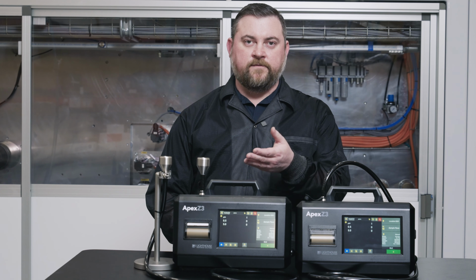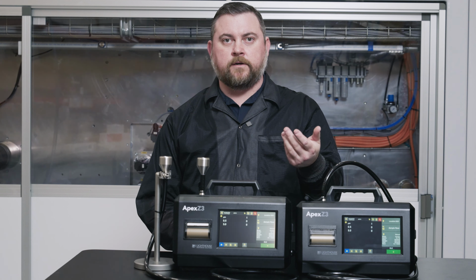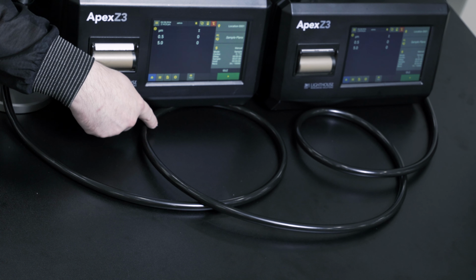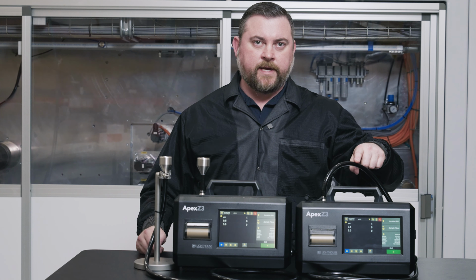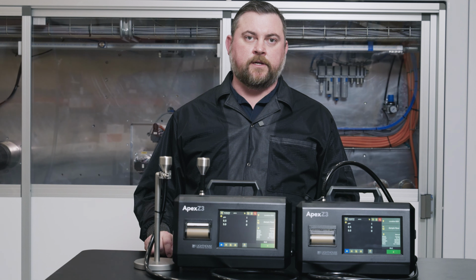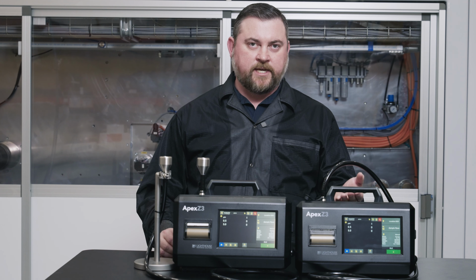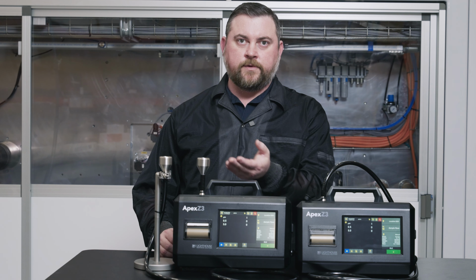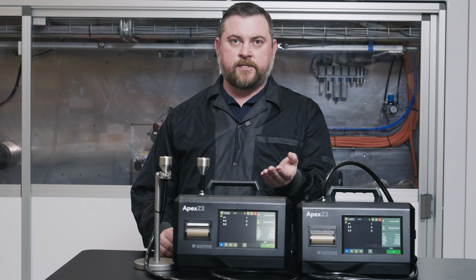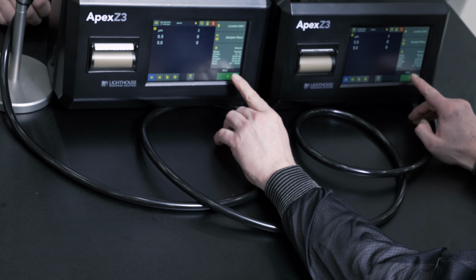Okay, so we've got our 10 feet of tubing connected with our 4 bends, mimicking our sample setup in our clean room environment. So we have 1, 2, 3, 4 bends, just like we will for this 10 feet of tubing in our sampling system in our clean room. And we've got our 10 feet of tubing connected to our test counter and a reference counter with its ISO probe as close as possible to the ISO probe connected to the sample tubing. And now we're going to set and start both of the counters at the same time.